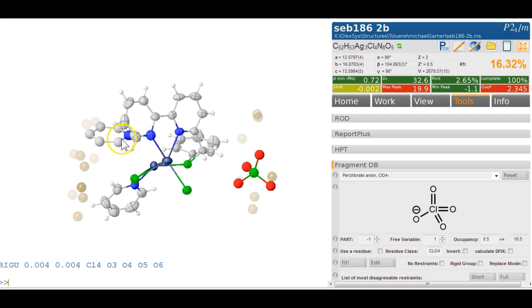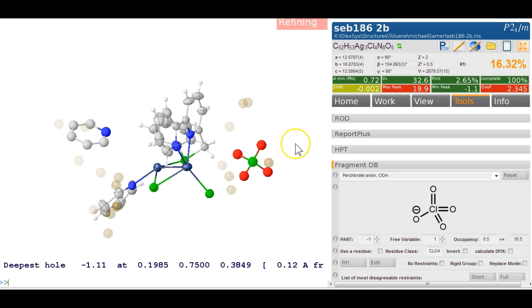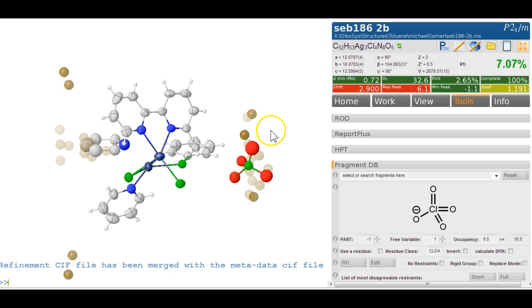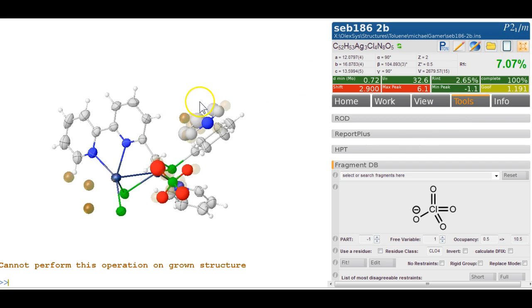So we've put in a pyridine and a perchlorate. That should be at part -1. It is, and occupancy 1/2. So hit Control R, refine it. And that looks like it's behaving quite nicely. There's other stuff in here, so let's just, it's a grown structure, so we need to type fuse first. Put all these peaks together and see whether anything sensible happens here.